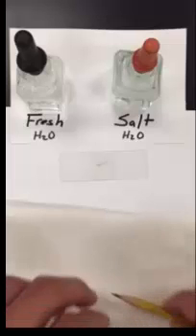All right so this covers steps one through three on your lab. So right now I'm going to ask you to pause this video and work on steps four through six. And when you're done you hit play again. Okay welcome back.